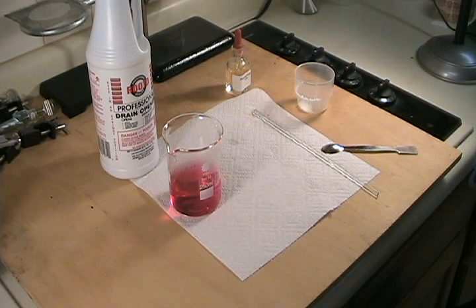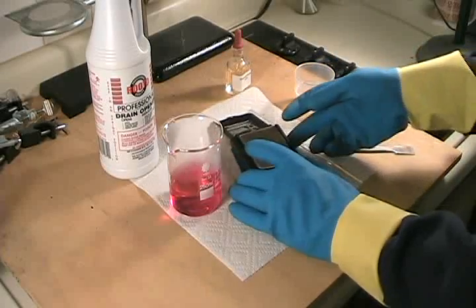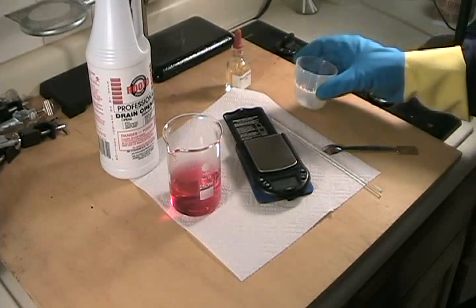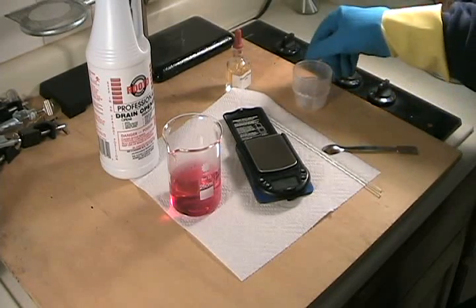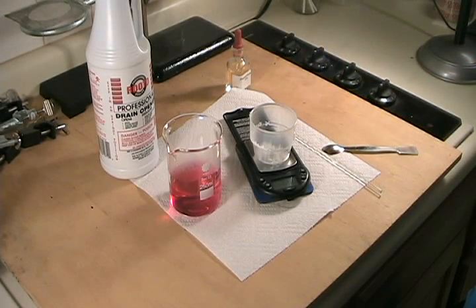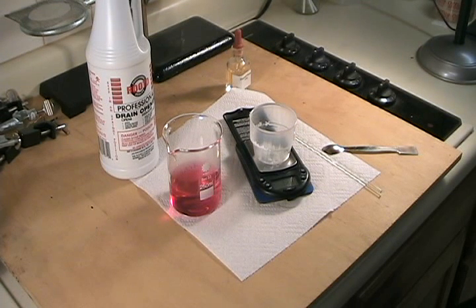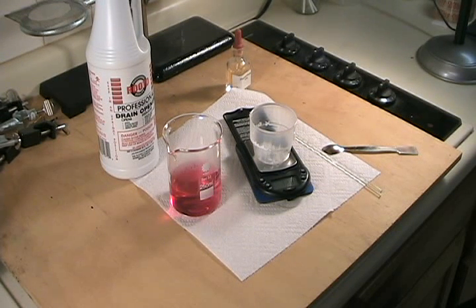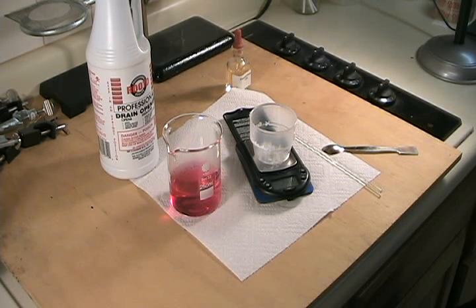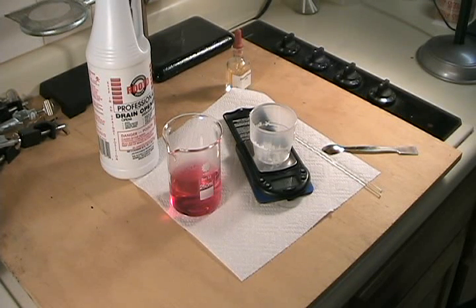Let's go ahead and re-weigh our weighing boat. We get 13.29 grams. We'll subtract the empty weight of the boat from that to determine how much sodium hydroxide we have left, and then subtract that amount from the original amount of sodium hydroxide to know how much it took to neutralize the 10 gram aliquot of acid.